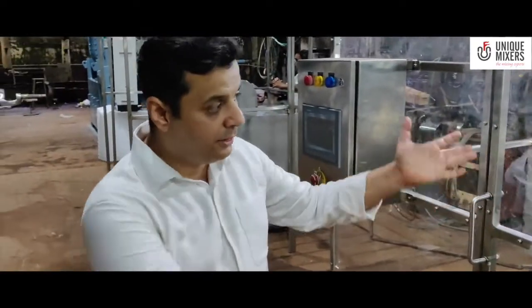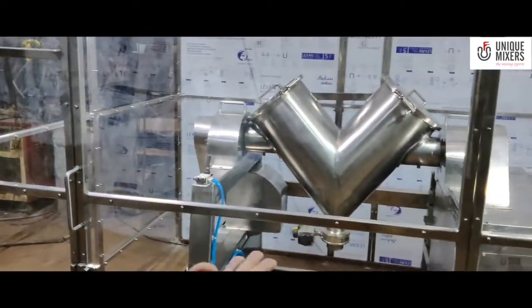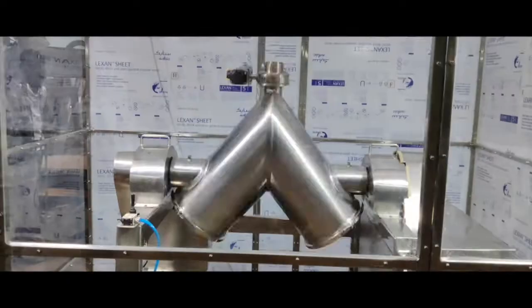Now that I am out of the machine we can actually start the machine. So yeah, the safety switch is now in place and the machine can be started.